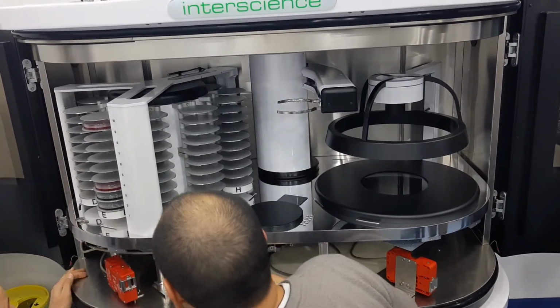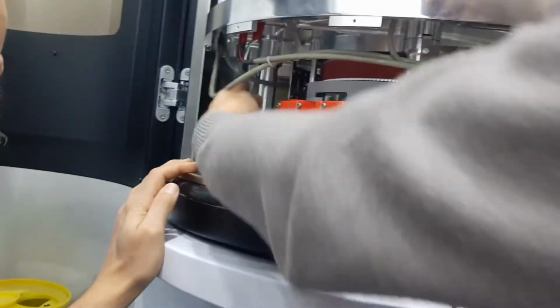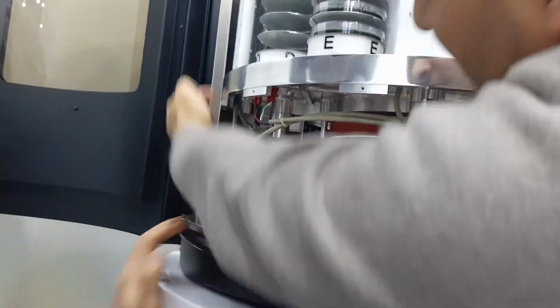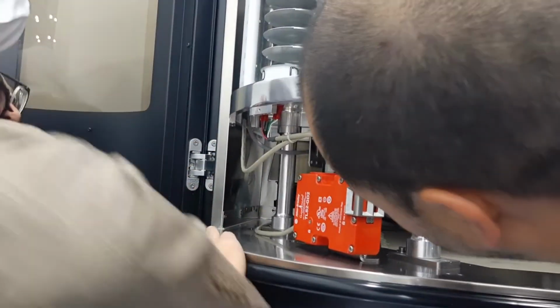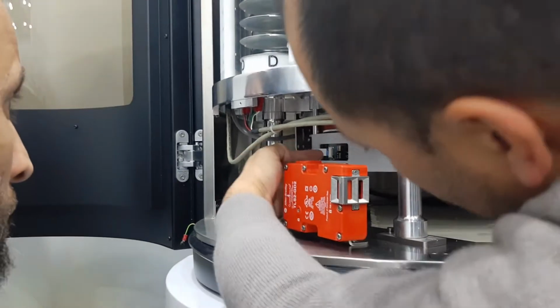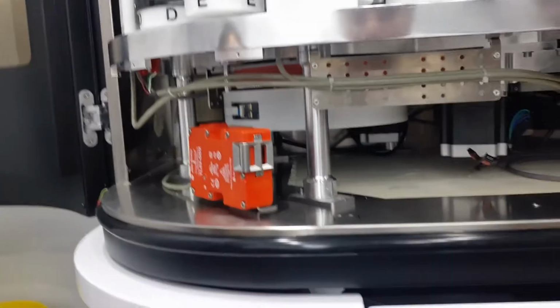Oh yeah, so maybe I can show you that. So that's the sensor. Sometimes we needed to change it, so I think there's 2 screws there to take off the block, and you can take off. And then I think there's a connector inside, so you can change the board without changing all the cable. Oh, that's the flexible cable from the sensor that goes out from here. So those are very sensitive, so you have to be careful not to touch them too much.